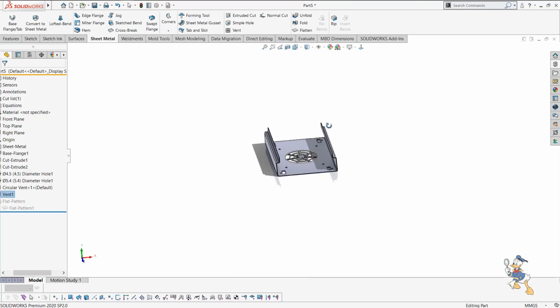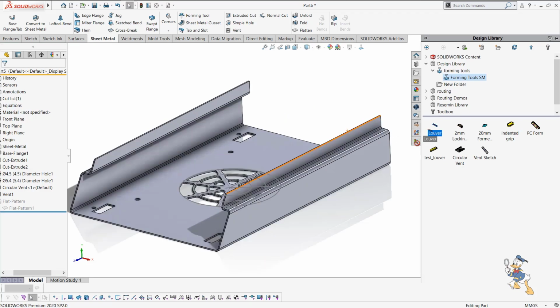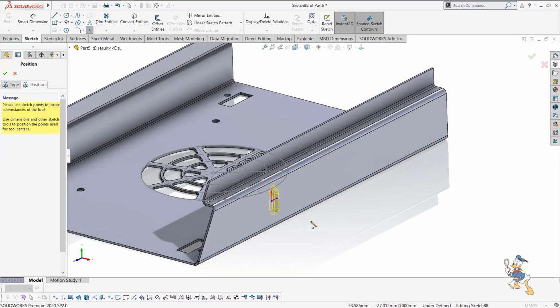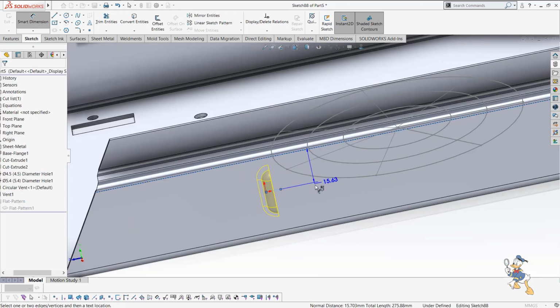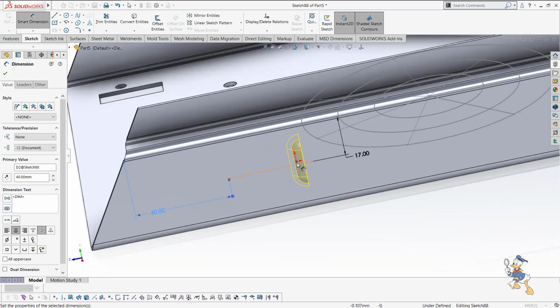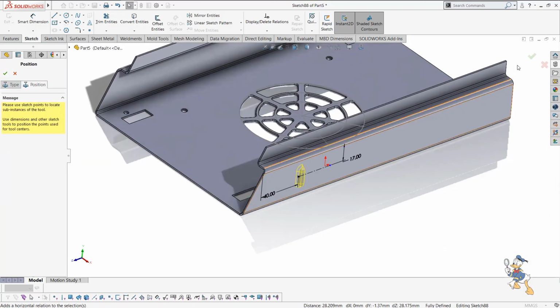Now suppose we need to provide some kind of forming tool in the sheet metal. So we just need to select over here, select some kind of forming tool, just like a louver. I just need to design over here, and then provide some details like this. We can provide the dimension as well by selecting. I just need to provide this line dimension. From here I just need to provide like 17 over here. We can provide the dimension of the point, it would be like 40. I think it is enough, and we need to make these 2 points coincident as well, make coincident. Yeah, and just check it out, and it will generate a louver row here.